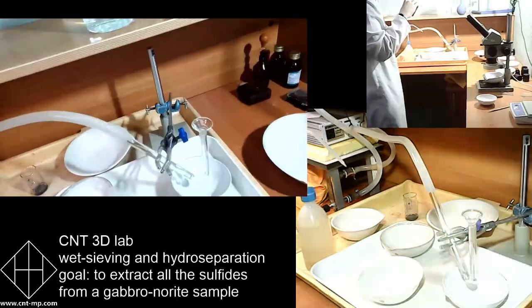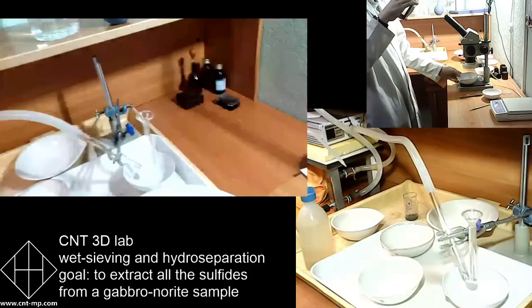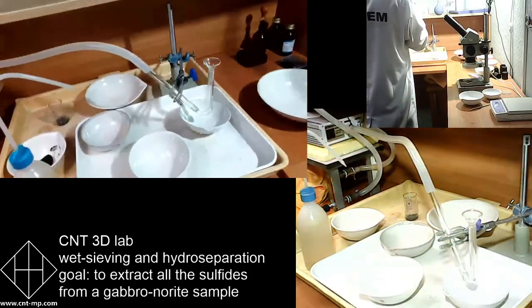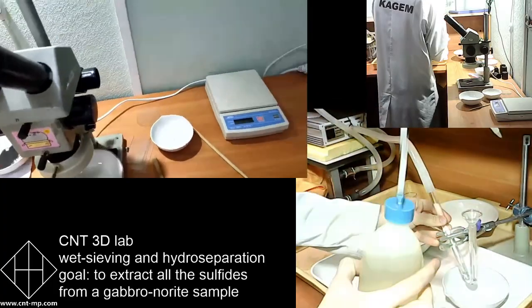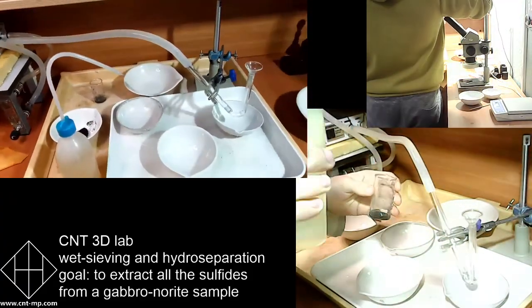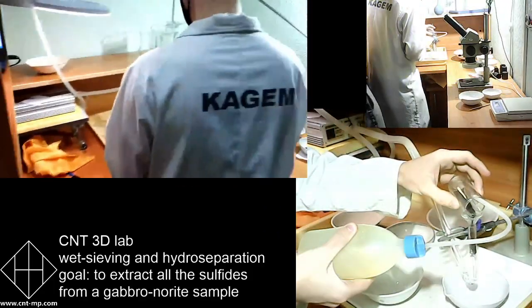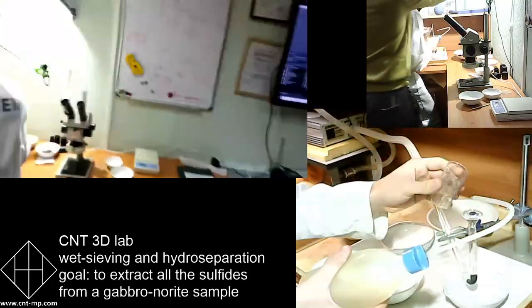So we've done wet sieving. That is a treatment that you have to do before and after each pulse, for each sample, to separate between different fractions. In an ideal world, we take an aliquot, dry these hydroseparation tailings, later take an aliquot for assays, so we know how the concentrations of valuable elements are distributed throughout different sieve sizes.